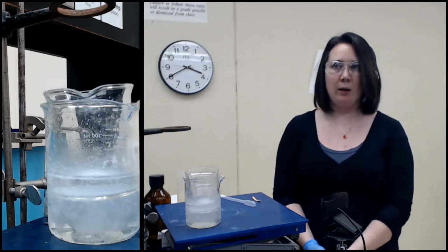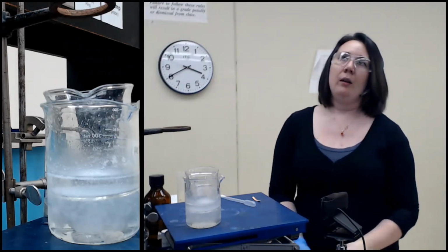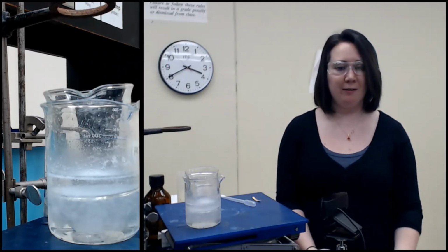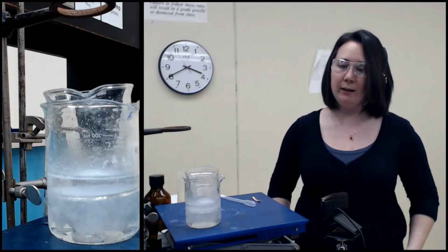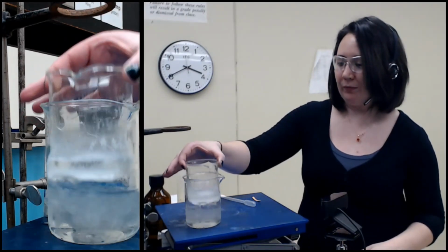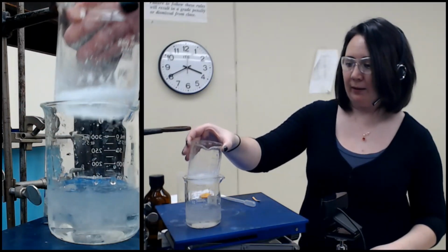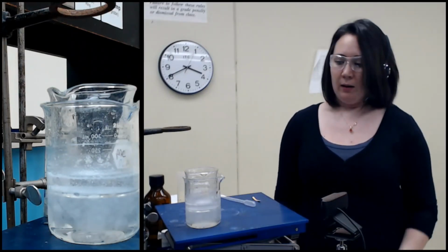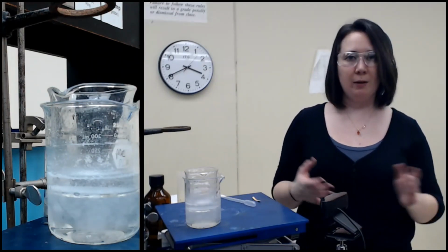So it would just be water, some sodium bicarbonate, HCl, byproducts of that reaction. So some sodium chloride is going to be in there, and water. And we want to just maximize as much solid as possible to come out. So we let that sit on ice. While I let that sit on ice, I'm going to go ahead and set up the rotovap.